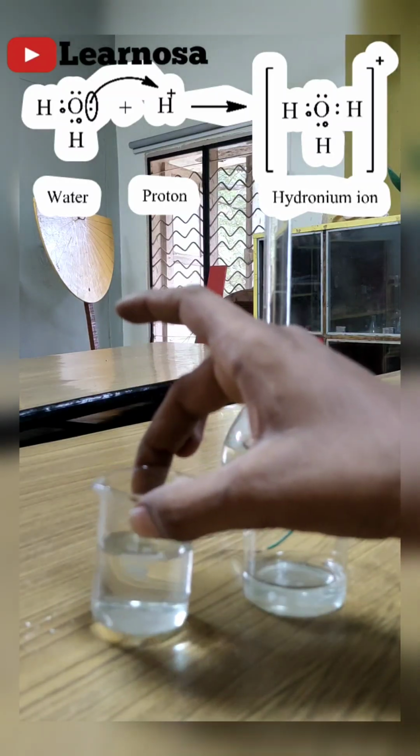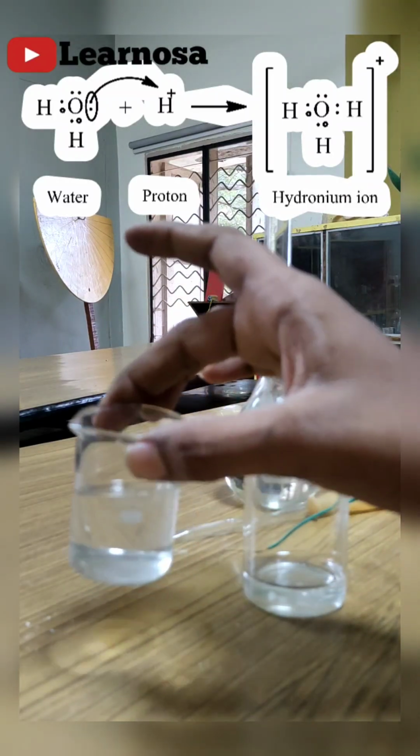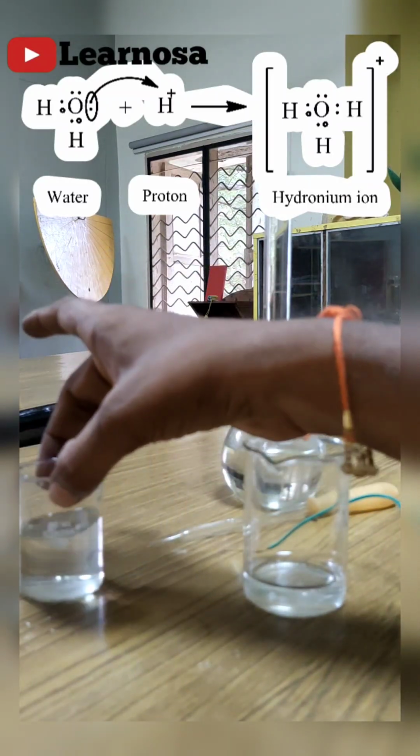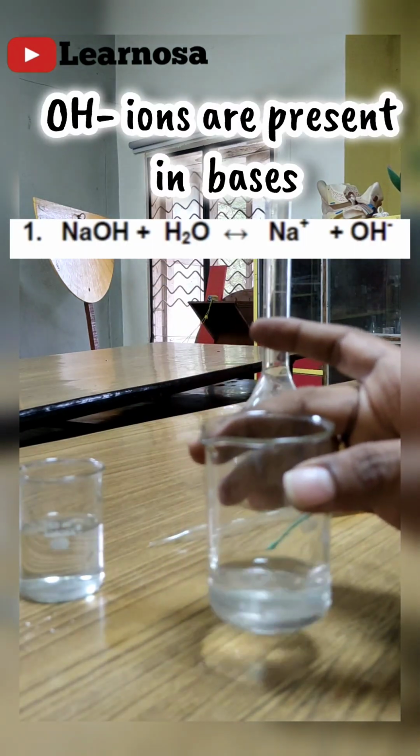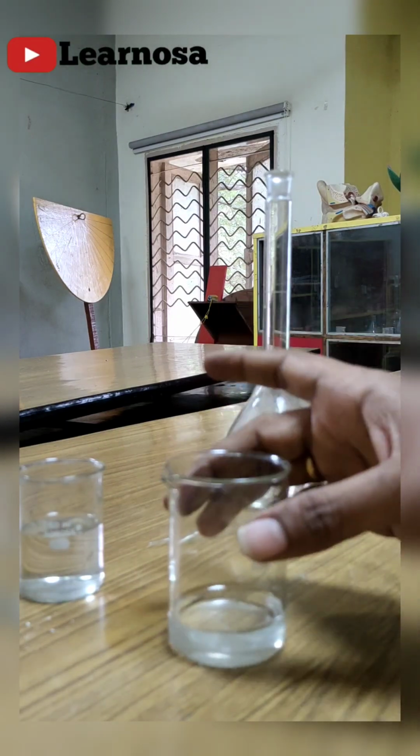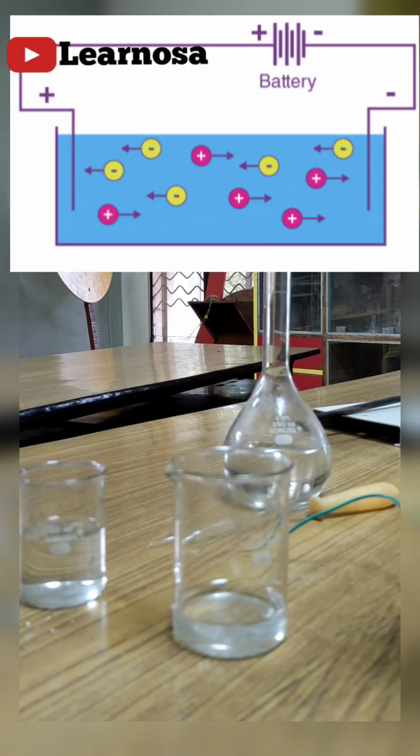So hydronium ions or H+ ions are present in acids. In bases, normally OH- ions are there, along with the respective metal positive ions. So in both of these we have ions, and ions are responsible for the conductivity of electricity.